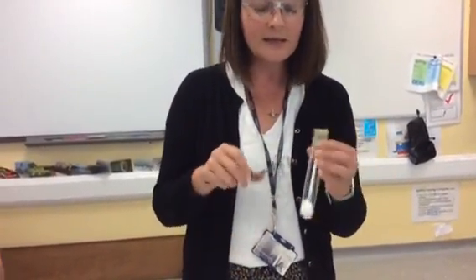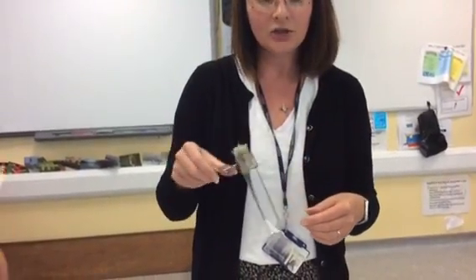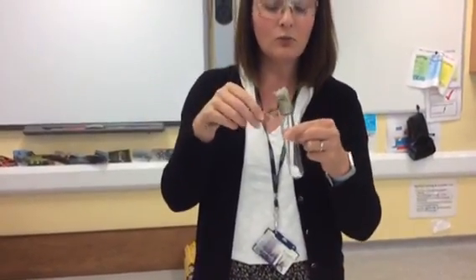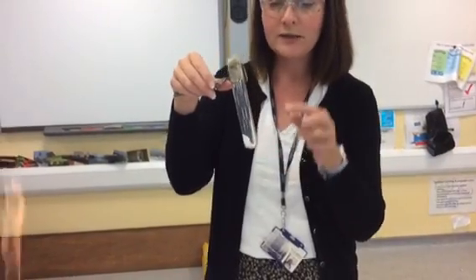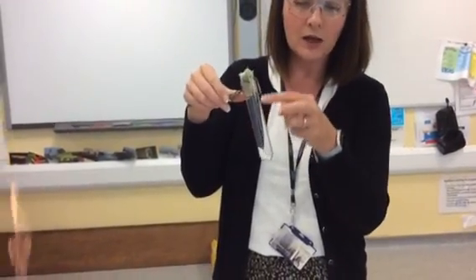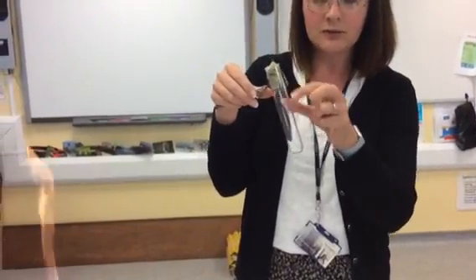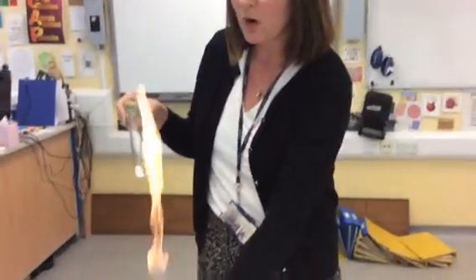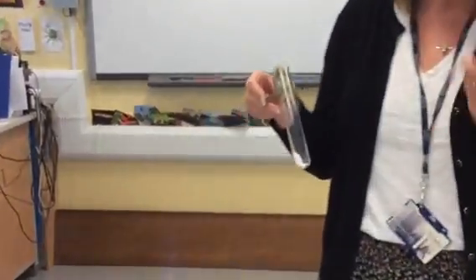So we're going to heat our ammonium chloride and as we're heating it we're going to look to see if anything changes, if the boiling tube looks different at all. At the moment we've got white solid at the bottom which is our ammonium chloride and nothing else in our boiling tube — we can see through it, there's nothing else there. Remember, ammonium chloride has the formula NH4Cl, so we've got some nitrogen, some hydrogen, and some chlorine present.